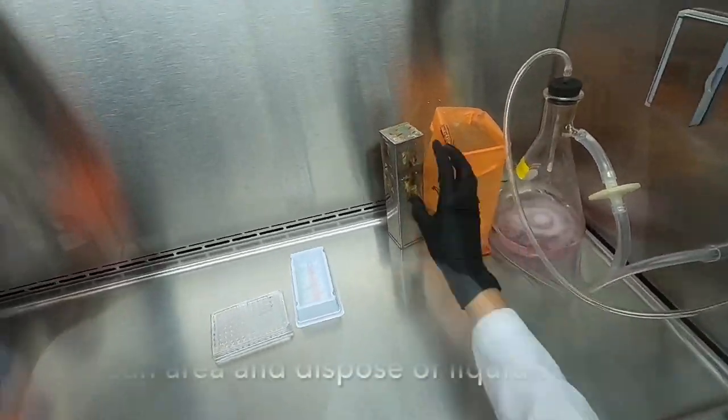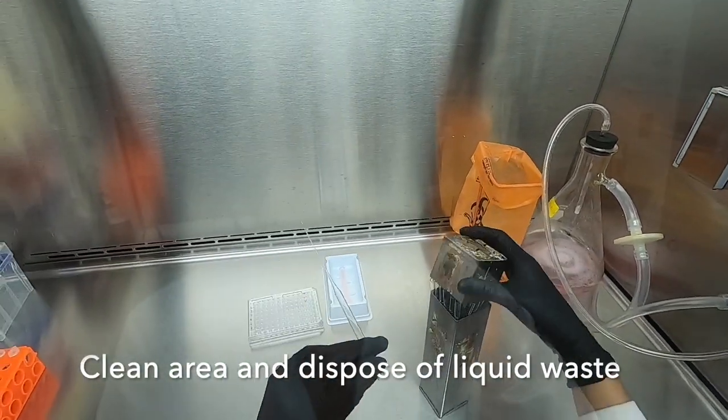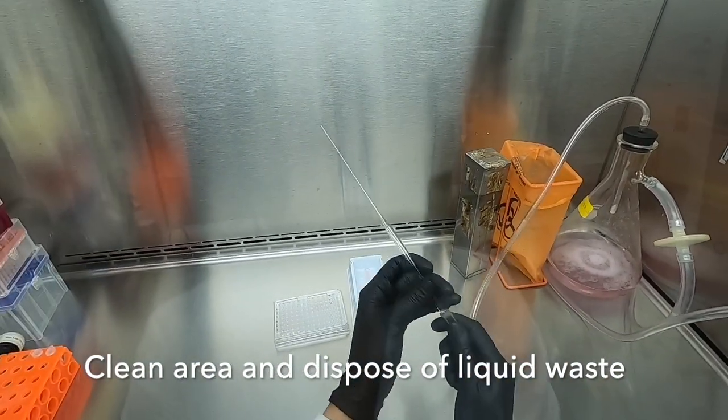Before leaving, always remember to clean your area and dispose of any liquid waste and solid waste properly.